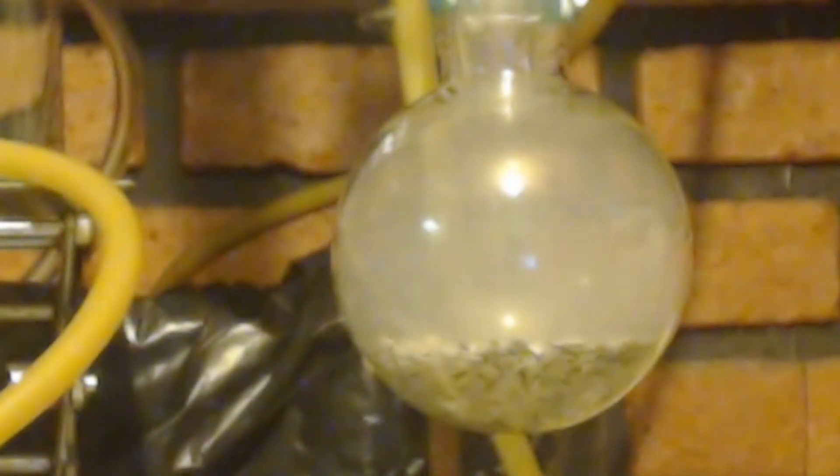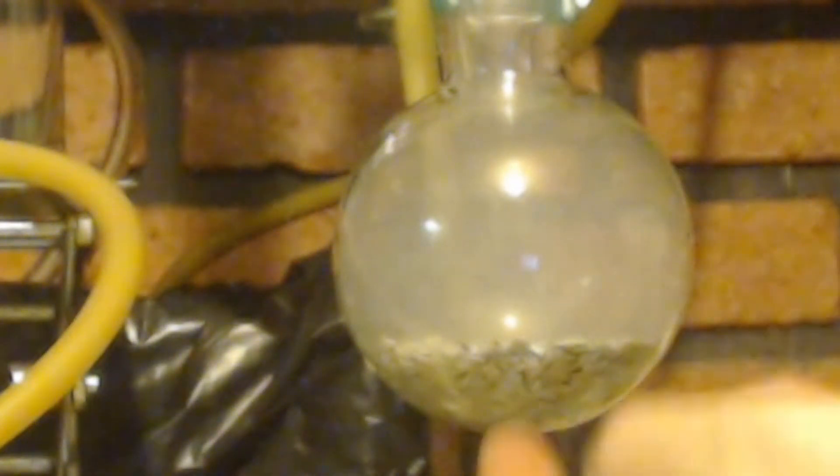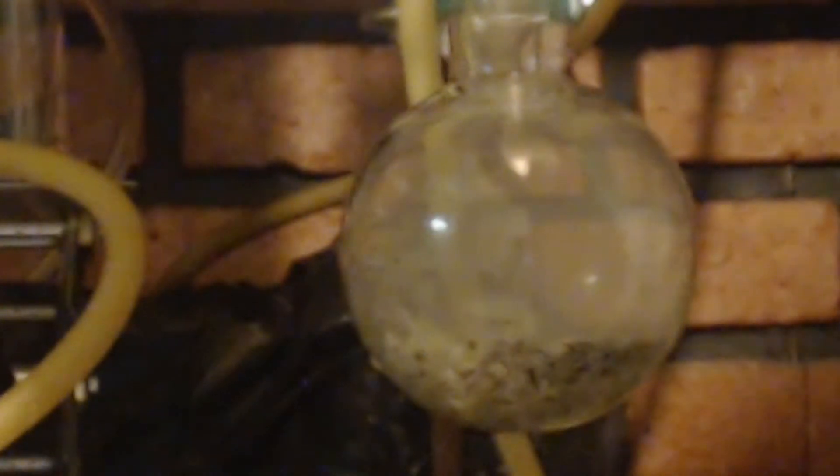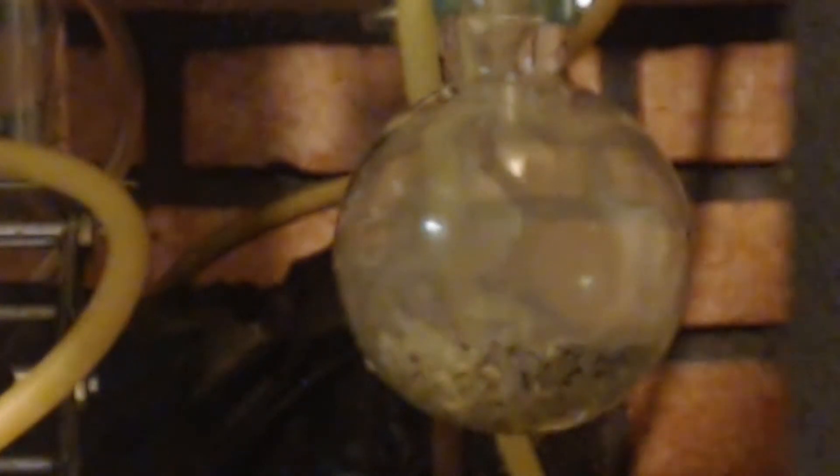I'm going to toss in another 20 milliliters or so of this. About 15 milliliters. I'll toss it right in the top. Just because I don't think there's enough in here, I think I blew some of it away at the beginning there. Holy shit.